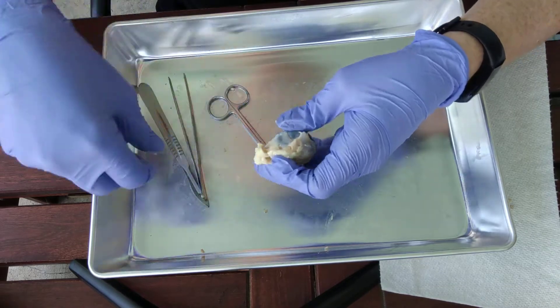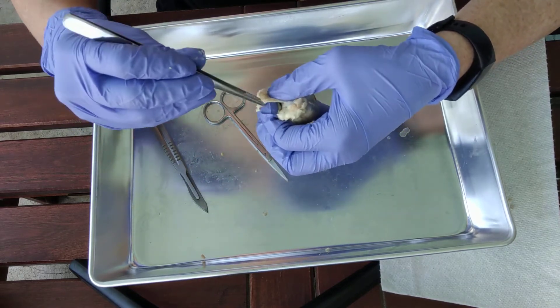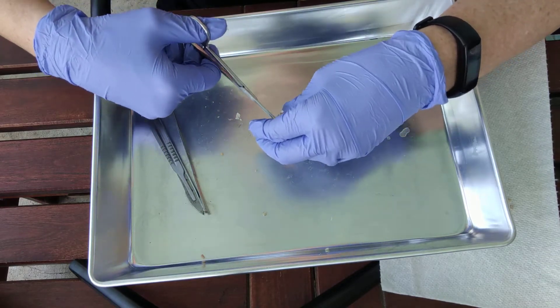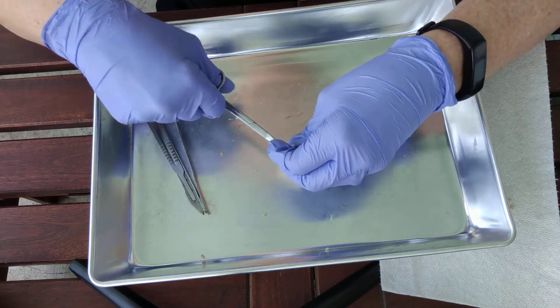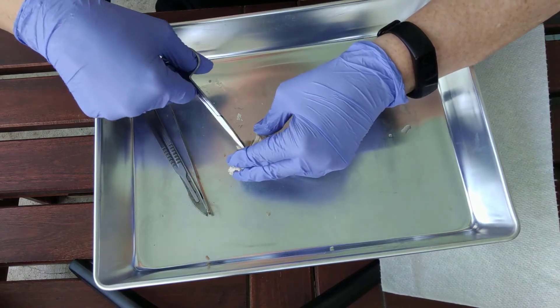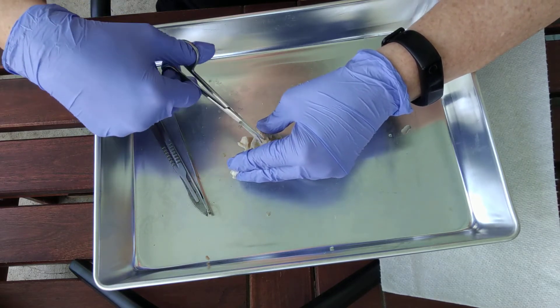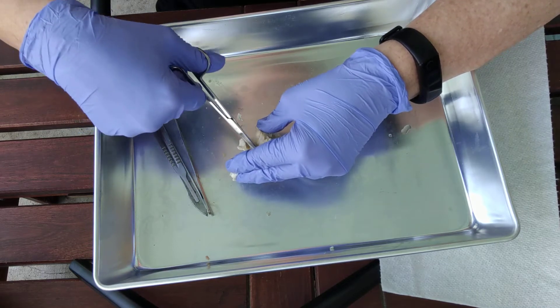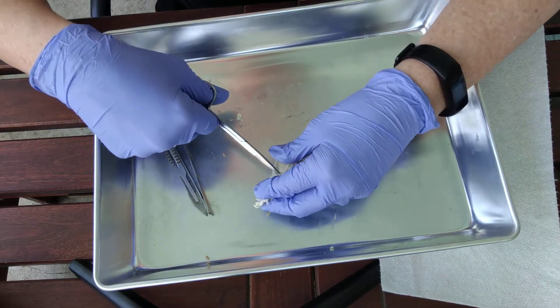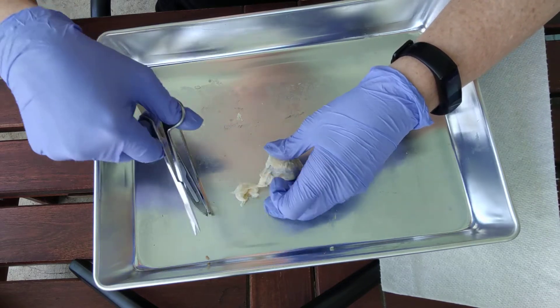I'm going to try to pull off the fat without pulling off the muscle. Think of it like steak — if you see something that looks like steak, that is muscle. Meat is muscle. What I'm doing right now is my stick-and-spread technique. Just spread it apart to make sure there's nothing in it. Before you do any cutting, you want to make sure there's nothing inside. Once you're really sure there are no muscles hiding in it, then you can go ahead and cut it off — spread it apart, tease it apart first.